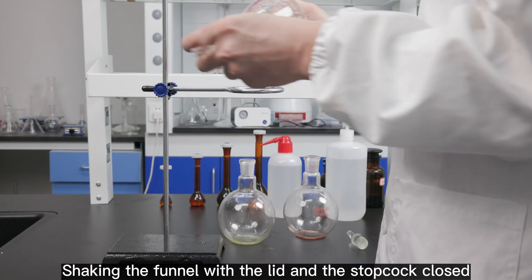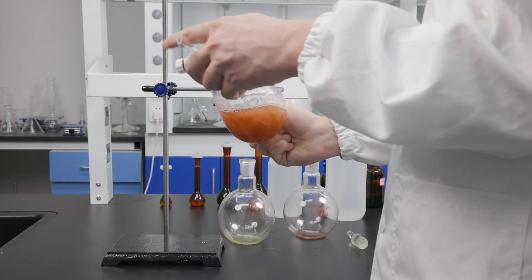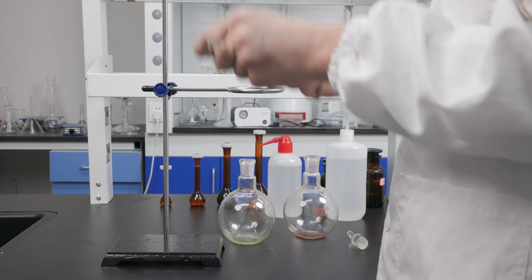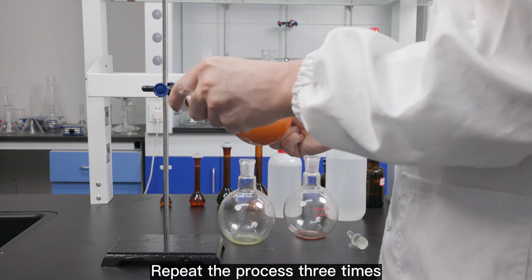Shake the funnel with the lid and the stopcock closed. Then, open the stopcock to release the gas. Repeat the process 3 times.